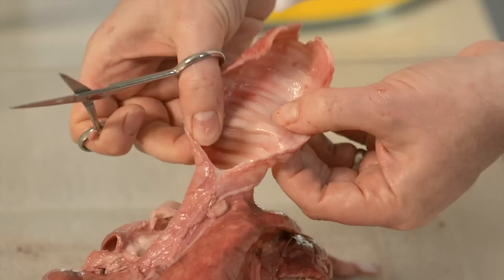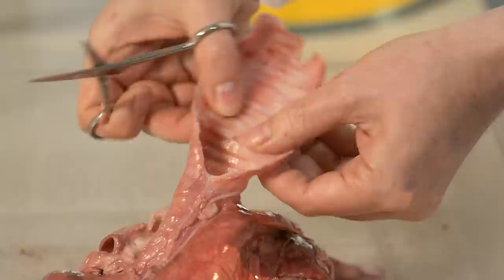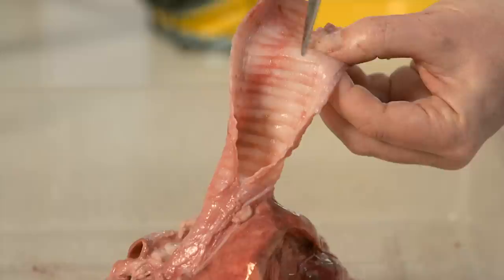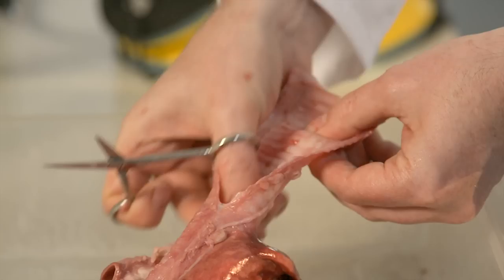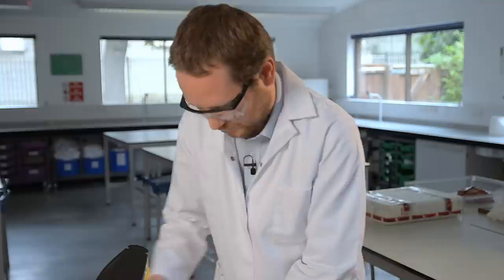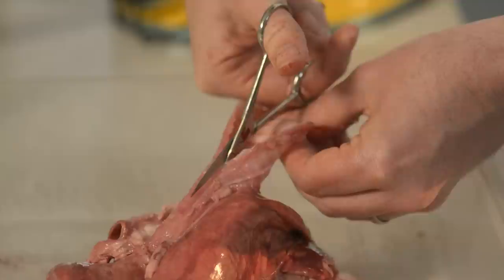Go all the way down and we can really see this ribbed rings of cartilage. They're not rings anymore because we're opening them out, but there they are, the cartilage pieces. There's one here that isn't just a ring, it's got two bands to it, it's broken, slight changes between each one, thicknesses. Sometimes that's not represented in diagrams, real life is a bit messier than diagrams.